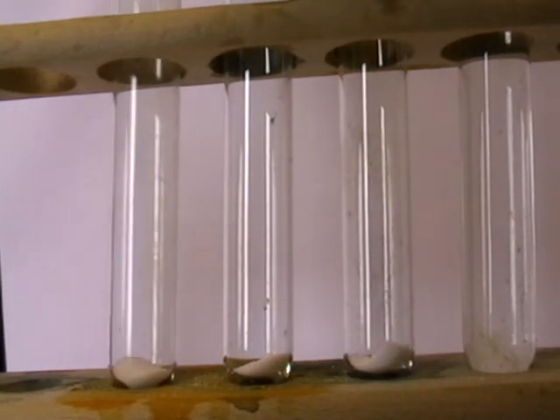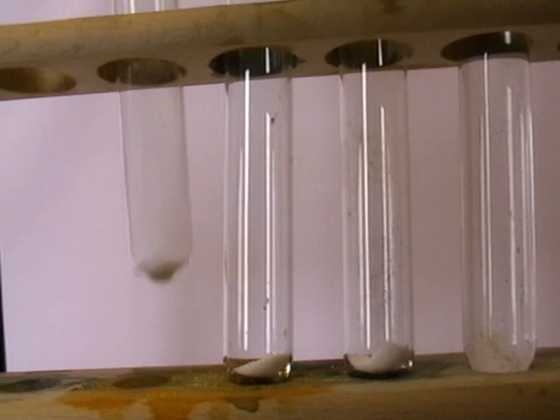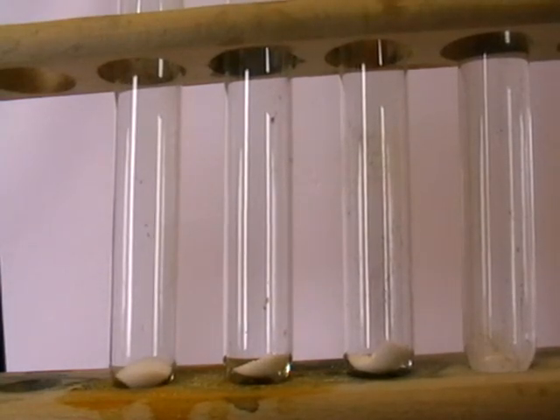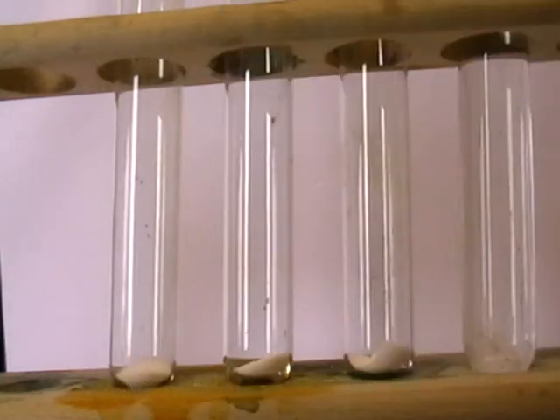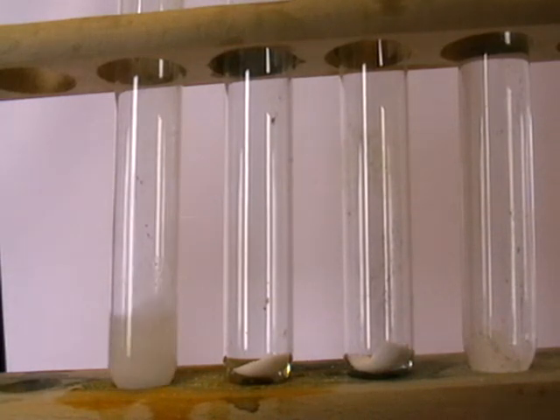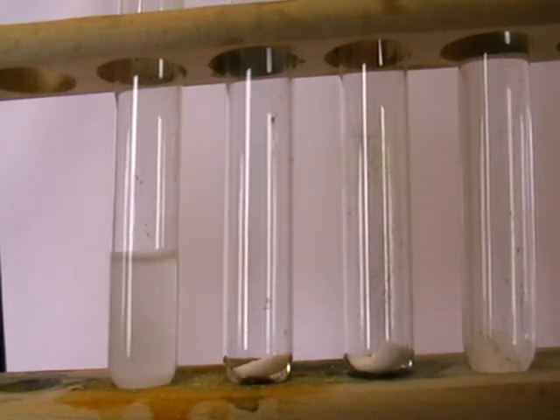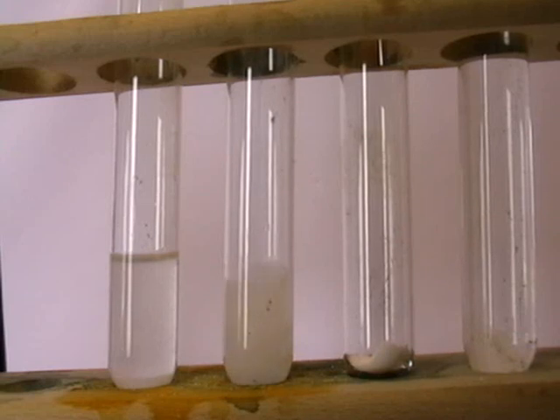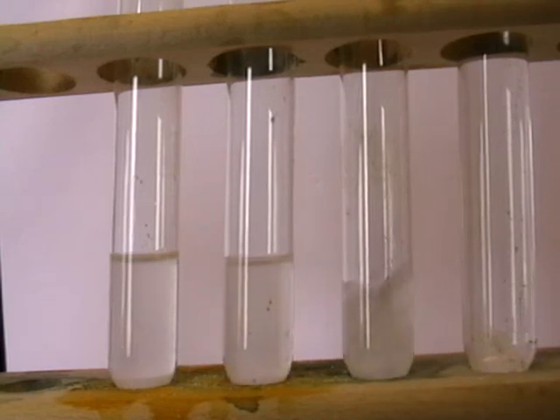Each of these halide salts are of sodium, and they are white crystalline solids. I'm going to add deionized water to each to make a solution. That's the solution of aqueous sodium chloride, aqueous sodium bromide, and aqueous sodium iodide.